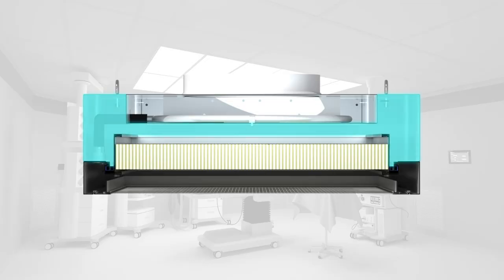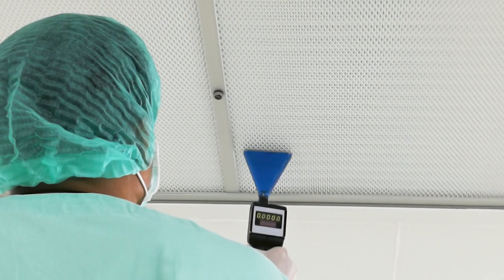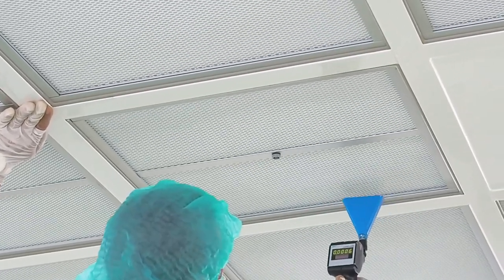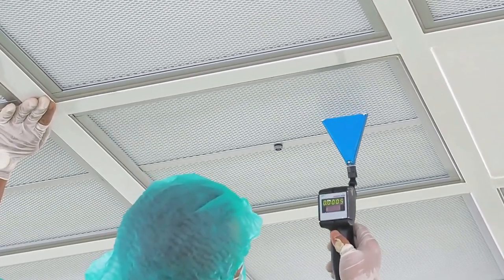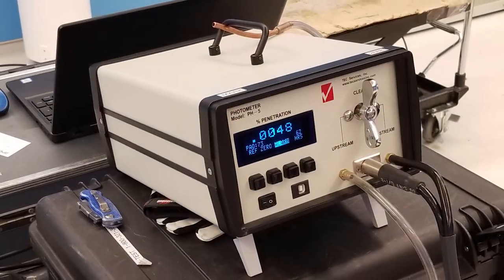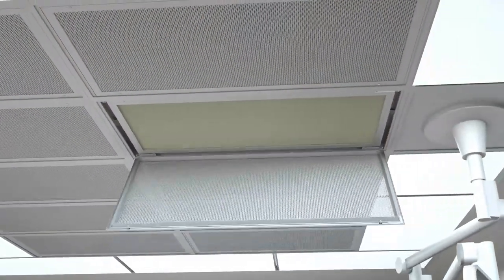Aerosol concentration upstream of the filter can be sampled through the static pressure aerosol sample port. Scan the filter and diffuser casing to verify overall unit integrity. If leakage in excess of the approved limit is detected, follow the diffuser and filter vendor's recommendations for troubleshooting and field repairs if needed. Finally, disconnect the test equipment, reinstall the plugs in the aerosol injection port, and reinstall the diffuser face.